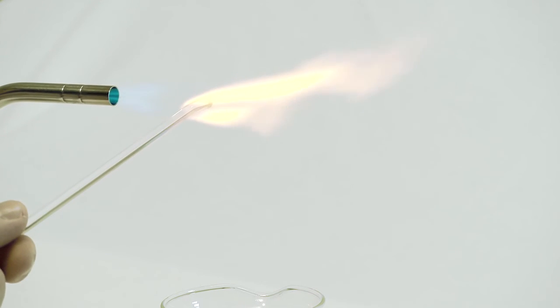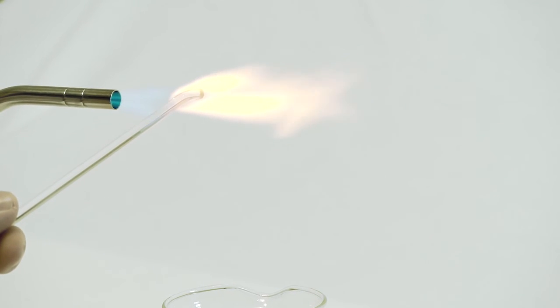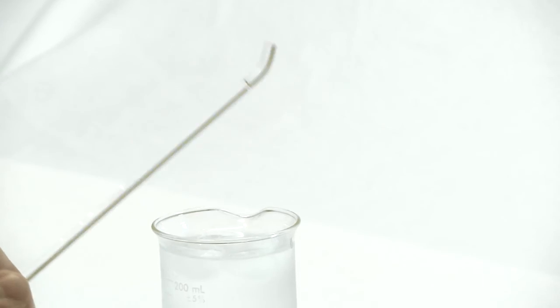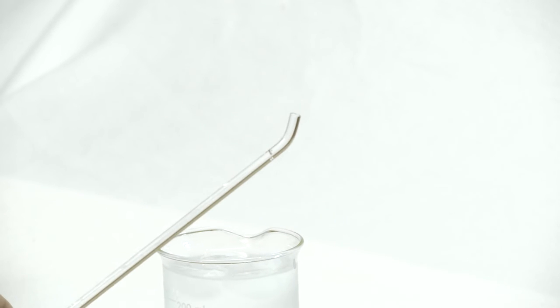Some thermal shock will occur, but there should be fewer overall cracks than with the soda lime glass. There should be 1 or 2 cracks at the interface between where the glass rod was in the flame, and where it was not.